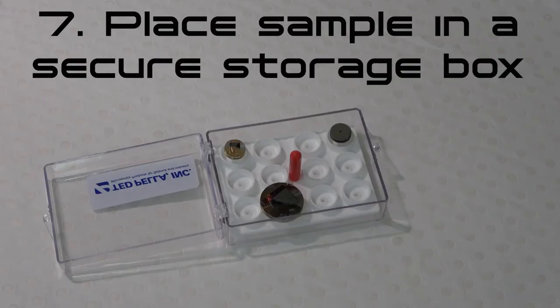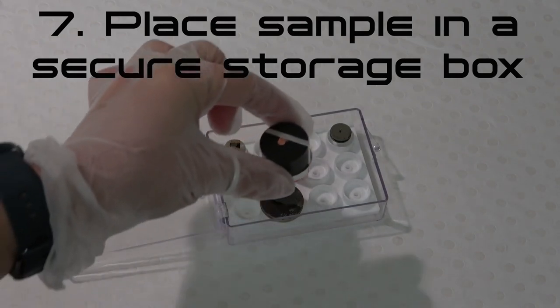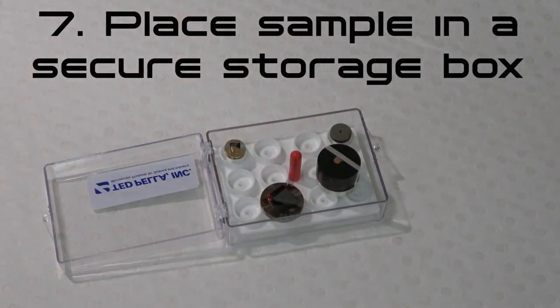Step 7: Place the mounted sample in a secure SEM storage box. Keep samples stored in a clean, dry environment.